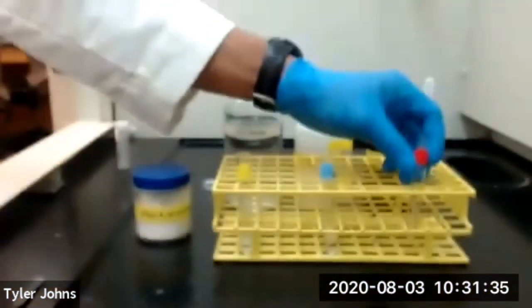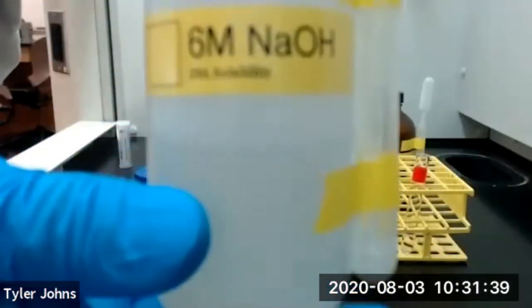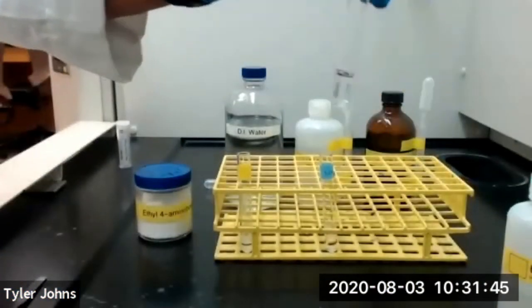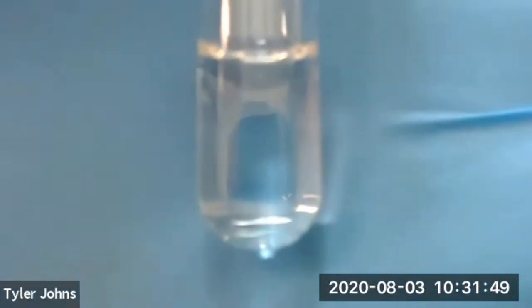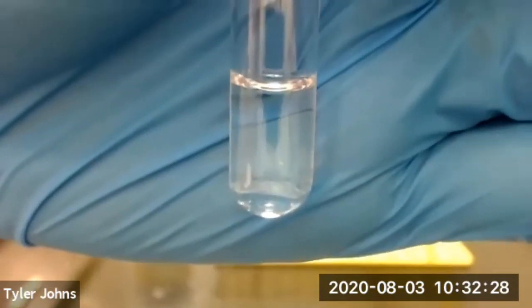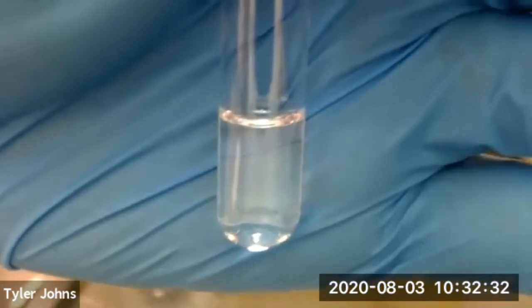We're next going to add dropwise 6 molar sodium hydroxide to our third test tube containing the 1 molar hydrochloric acid and ethyl 4-aminobenzoate mixture. We'll now add 6 molar sodium hydroxide to our 1 molar hydrochloric acid and ethyl 4-aminobenzoate mixture.